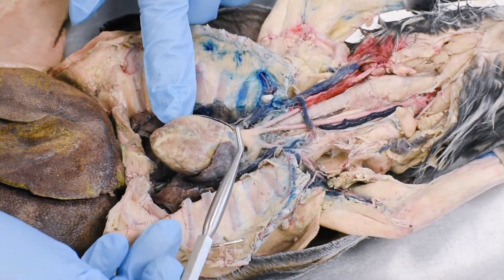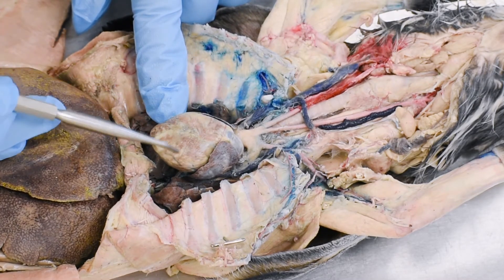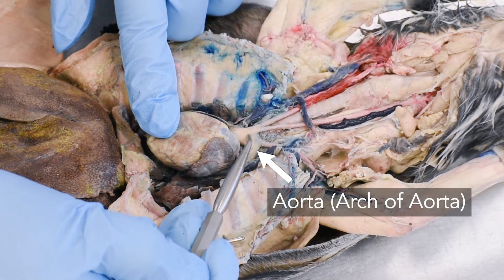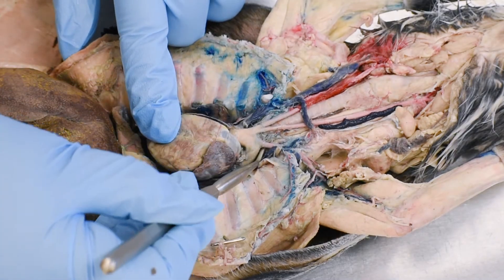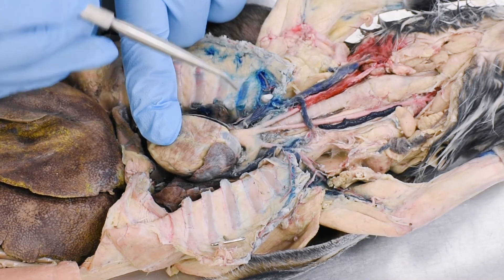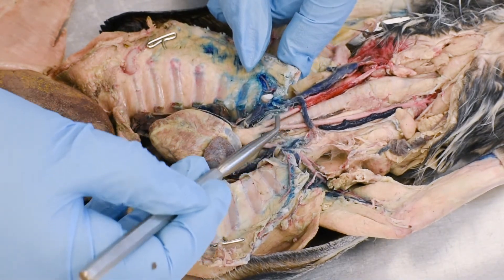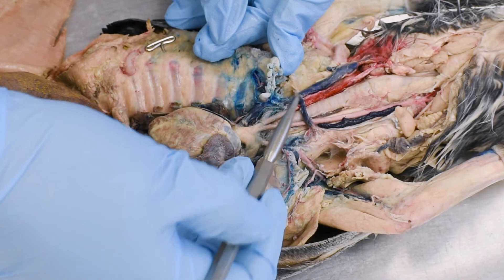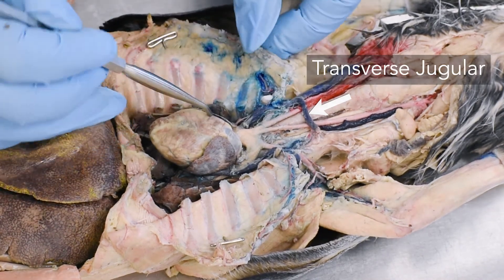Now you can distinctly see the heart because the thymus gland and the pericardium have been removed. The top two chambers are the atria, the bottom two are the ventricles. The first blood vessel coming out of the heart from the left ventricle is the aorta. This particular part is called the arch of aorta, which is divided into two major branches. The first one on the left side is the left subclavian artery. On the right is the brachiocephalic trunk, which is then divided into three branches: left and right common carotid arteries, and the right subclavian artery. We can see these are the jugulars — the external jugular. This is a bridge called the transverse jugular, which is present in the rabbit but not in humans.